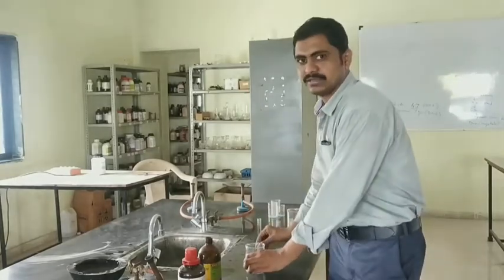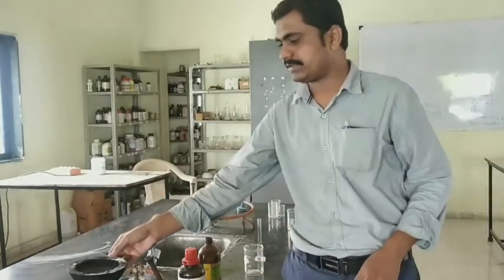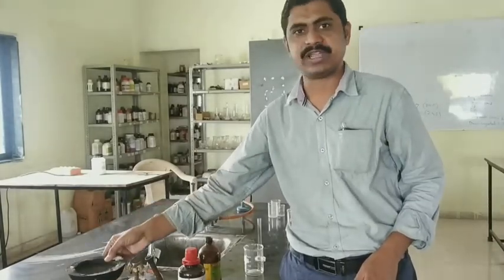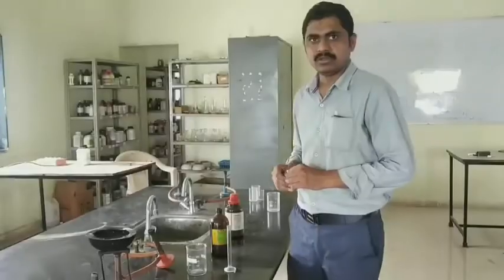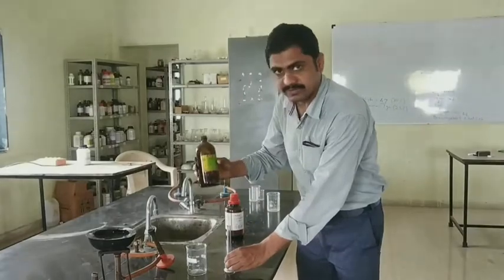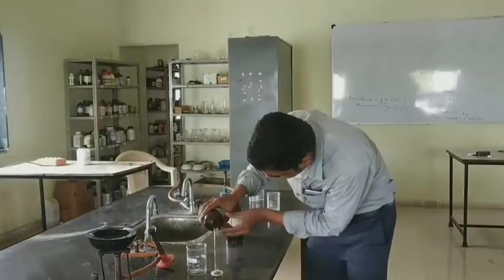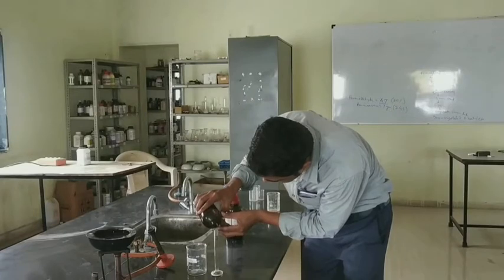Along with that, a water bath and tripod stand with gas connection are also required. Now I will take 4.7 mL of formaldehyde solution.